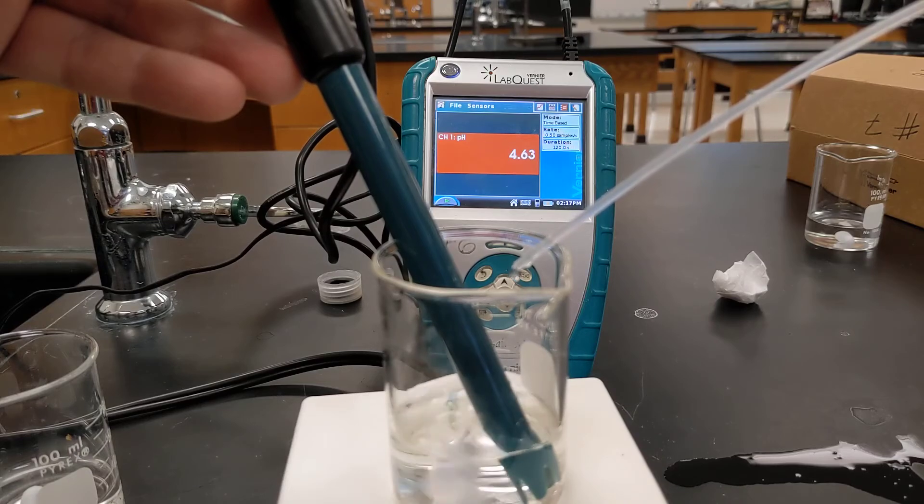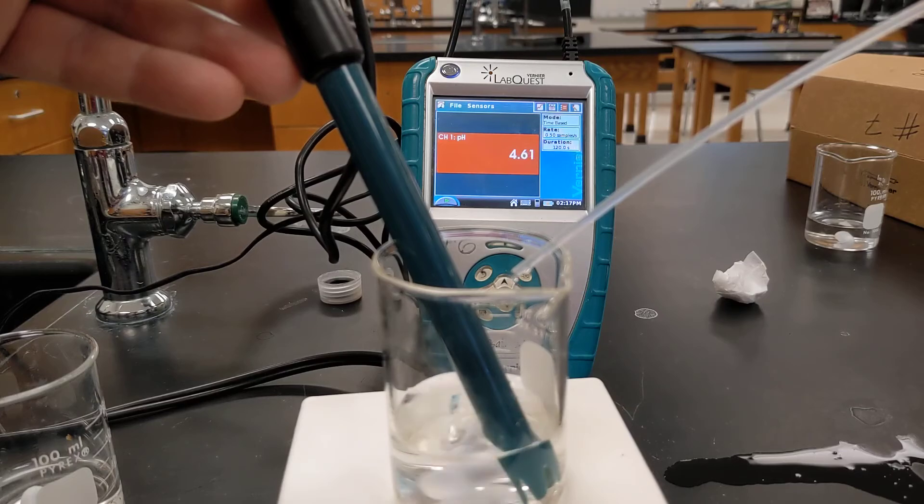See, I keep adding drops and the pH, although it goes down, is not going down by a whole lot.